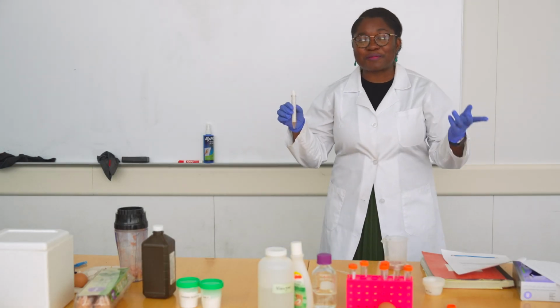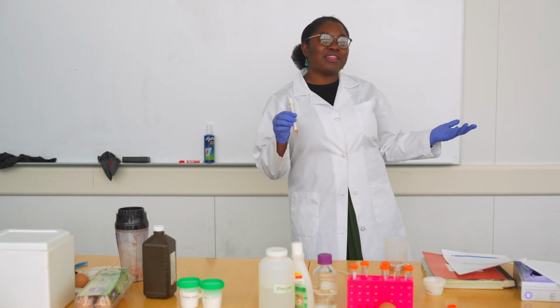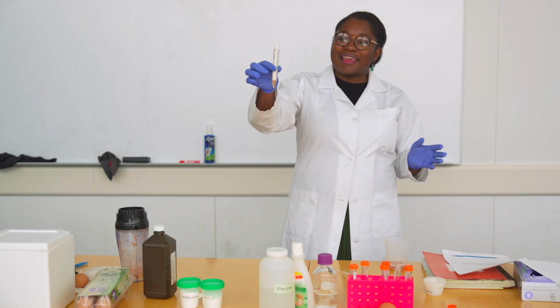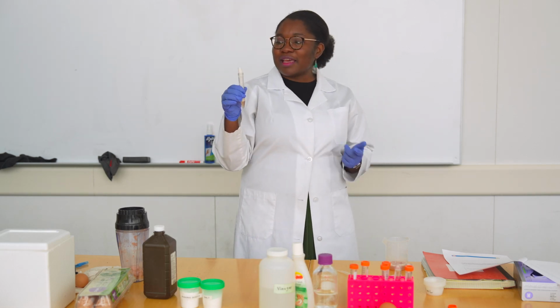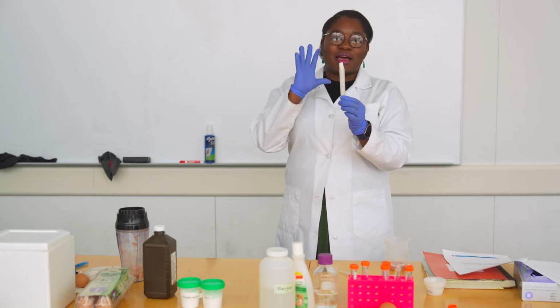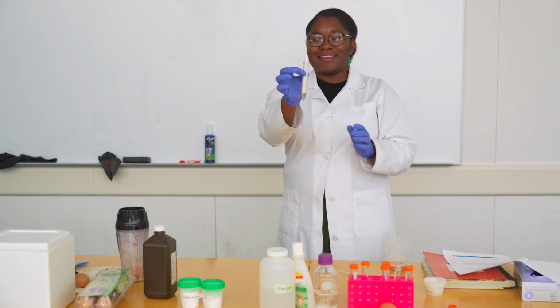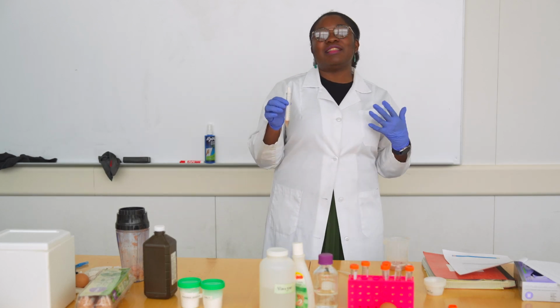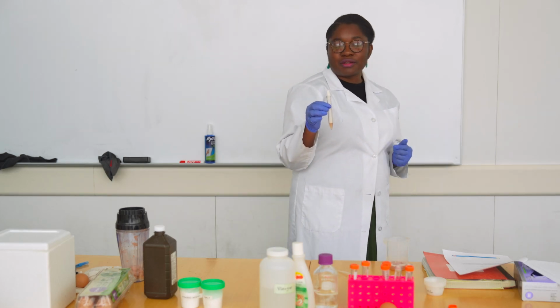Now we have done a few experiments testing the activity of an enzyme in potato, which we have been calling catalase, and we have been testing its activity with hydrogen peroxide. In one of these tubes is one of the experiments that we made, where we observed how the catalase reacts with hydrogen peroxide and releases oxygen that forms a little foam that grows tall as we go, and it's quite pretty. We also tested how this enzymatic activity can be slowed down by vinegar in some cases.